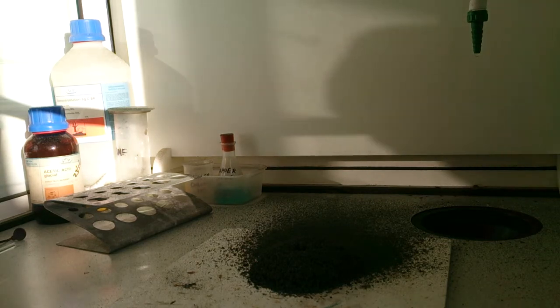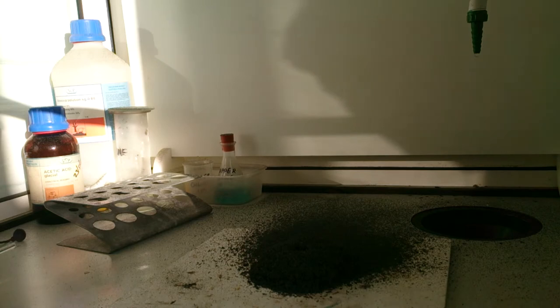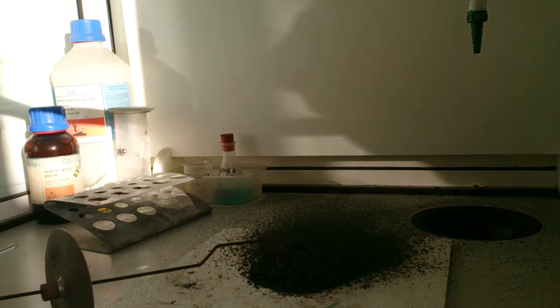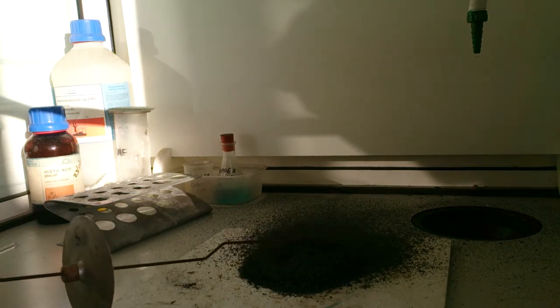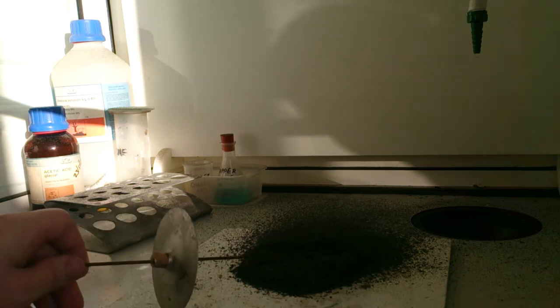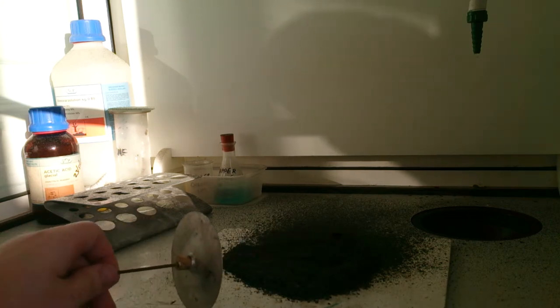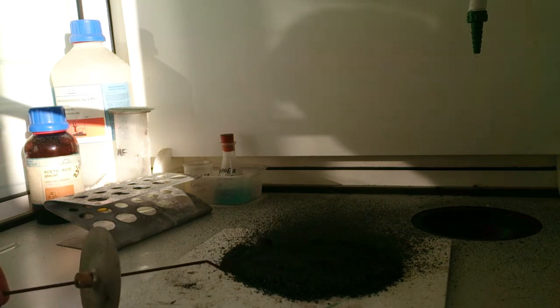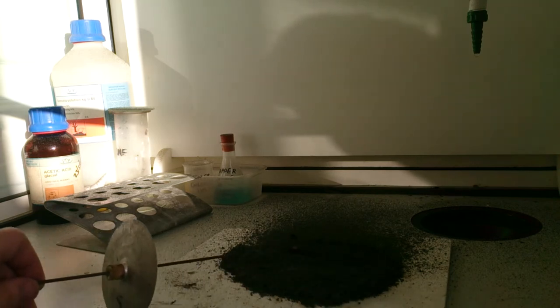Now, the ash itself is left. Inside there, there can be some residual which can go loud. So I'm going to spread it about a little bit just so I can see that it's not going to suddenly carry on reacting.